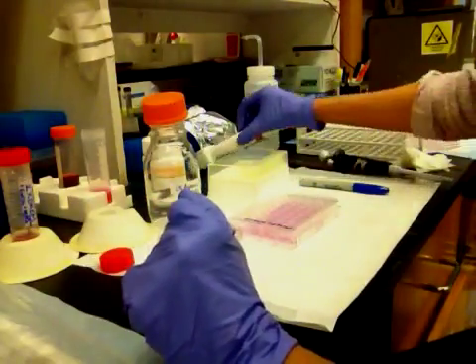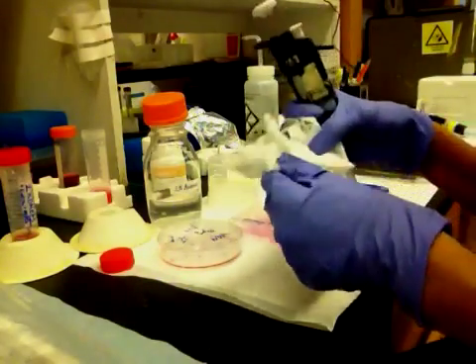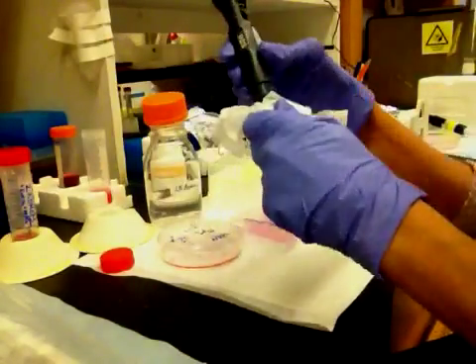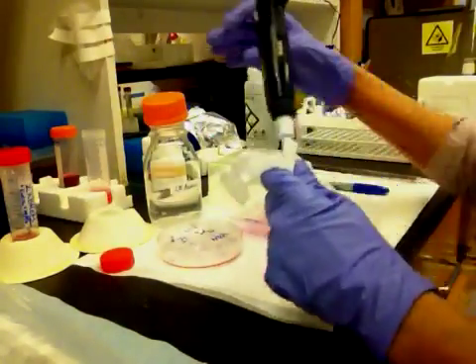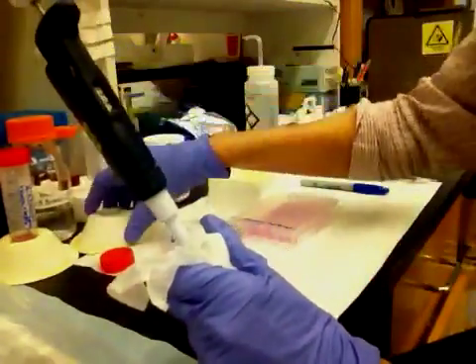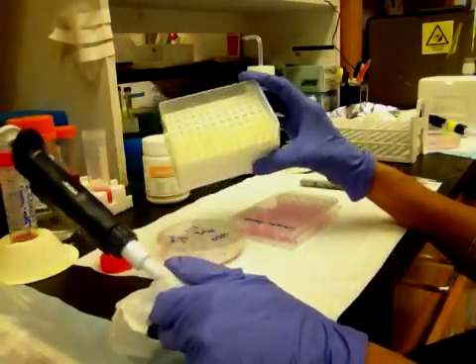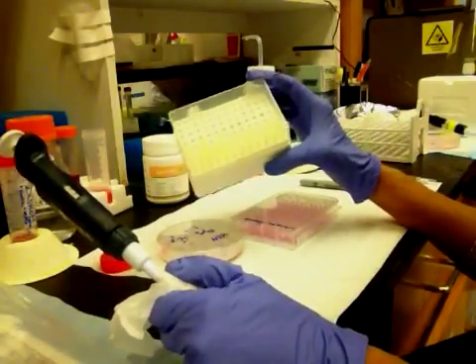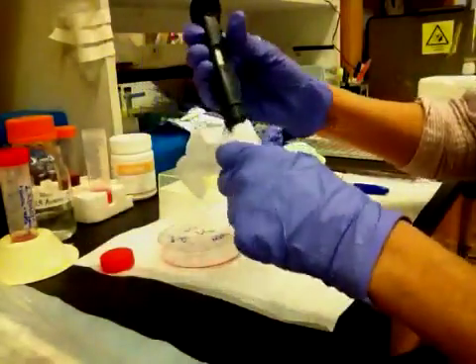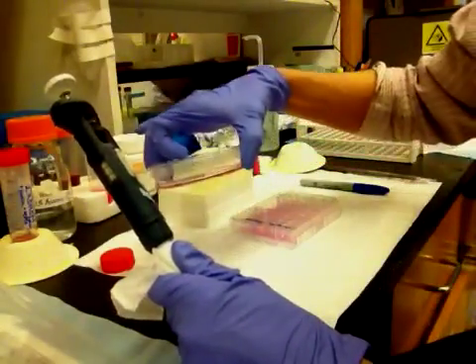Picking is actually a fairly rapid procedure. We're going to use a 200 µL pipette that's been washed with ethanol — since we're pretending we're working in the hood — and we're going to use these truncated special pipette tips that are sterile, which you can buy. You can cut your own and autoclave them, but they're really not expensive and I recommend just buying them. So how do you know that your cells are ready to be picked?